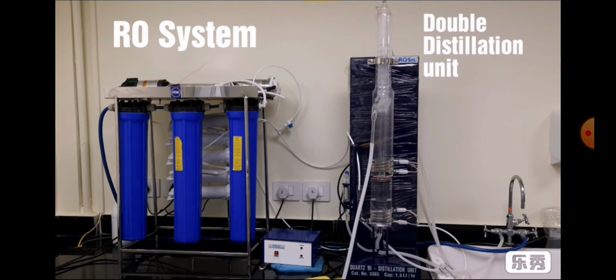Now, this one is the double distillation unit and this one is the RO system. The RO system will also remove some solid particles and give RO water, so the TDS, or total dissolved solids, of the tap water will be less. At first the tap water will come to this RO system, and through it the water will be purified and TDS will be reduced.